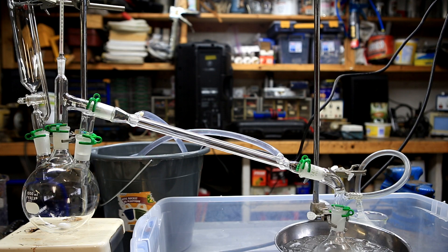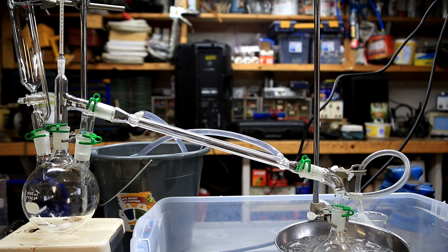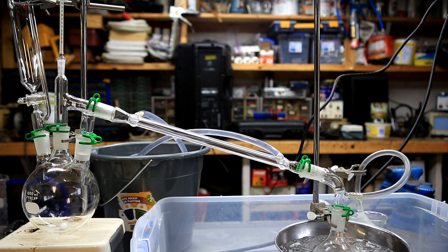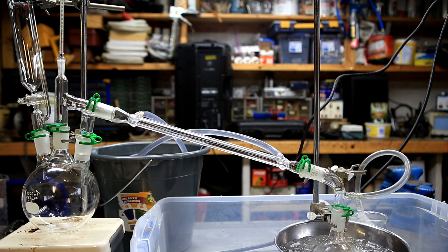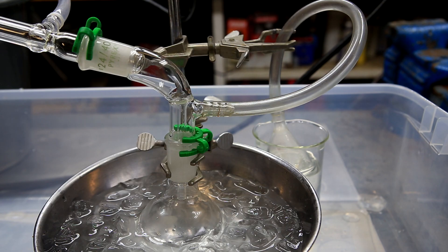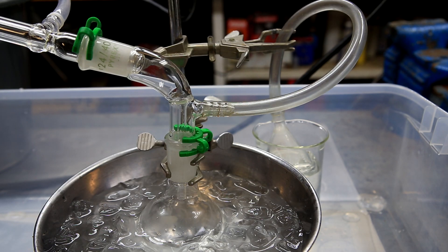The setup is a relatively basic, simple distillation. You can see on the left that I have an addition funnel attached to the round bottom, but this is optional. In order to limit losses, a long condensing column was used and it was cooled using ice water. Every single joint was sealed using concentrated sulfuric acid instead of grease, because the concentrated sulfuric acid is more resistant to bromine. The receiving flask is in an ice bath to prevent condensed bromine from escaping. The vacuum adapter leads to an inverted funnel bubbler trap to neutralize any bromine that escapes. As a precautionary measure against spills, I placed the second half of the distillation apparatus in a container.